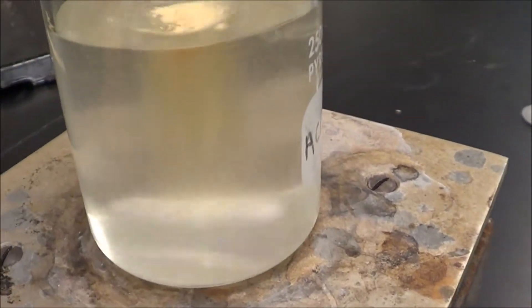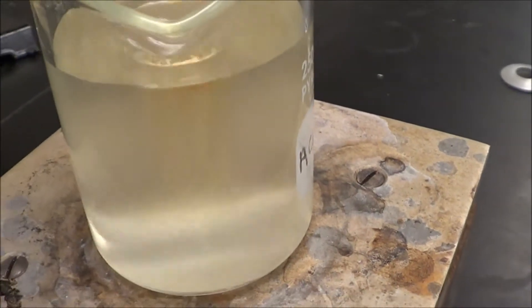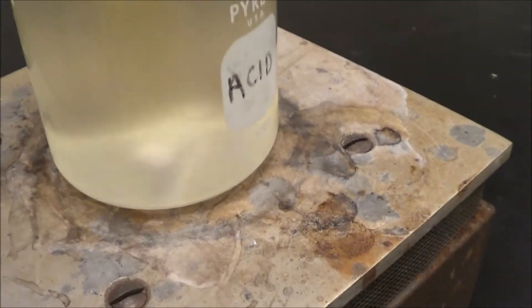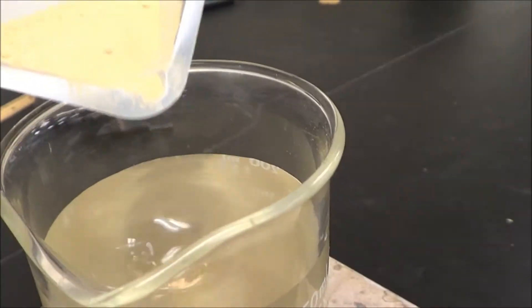It kind of looks like a tornado, doesn't it? And now we're starting to get it to move a little faster now. Add a little more.